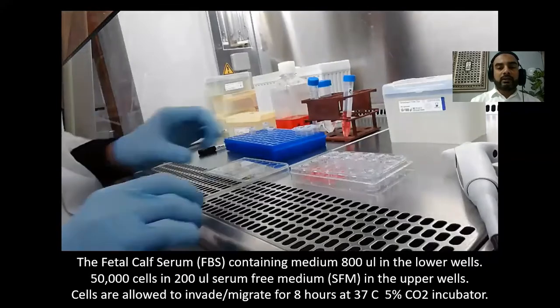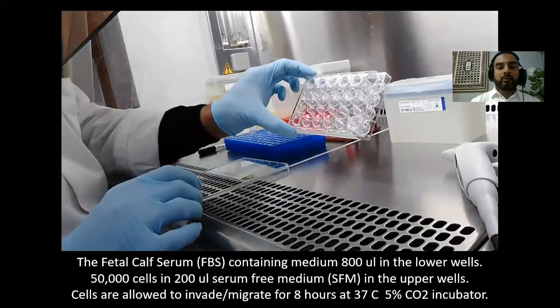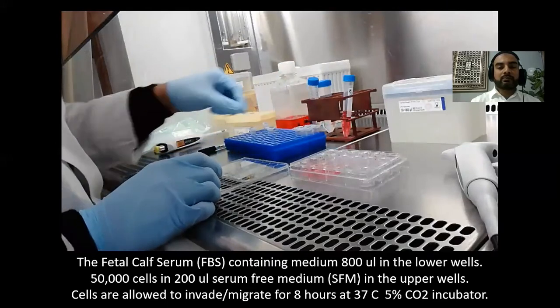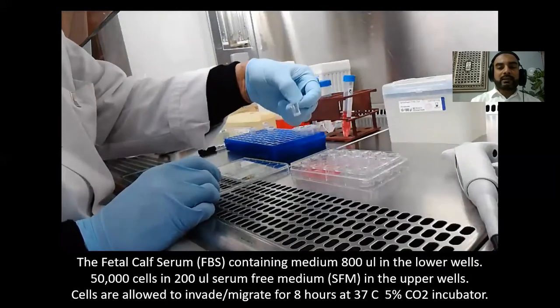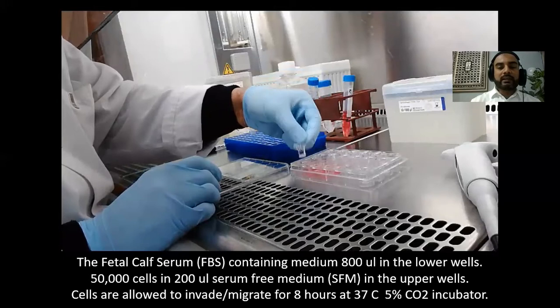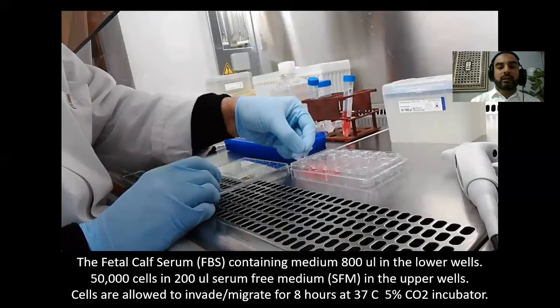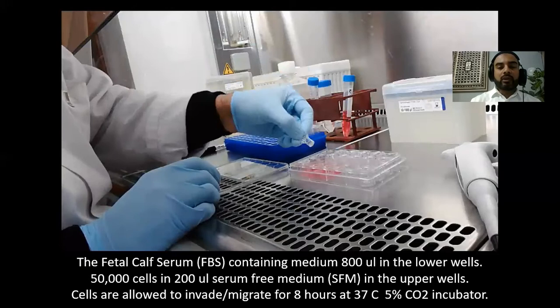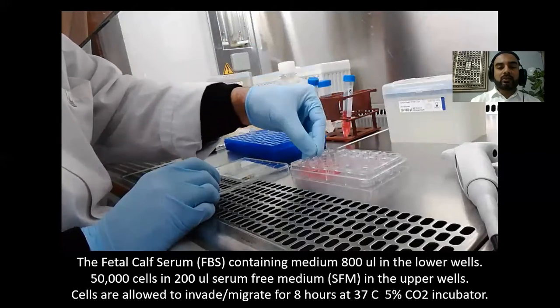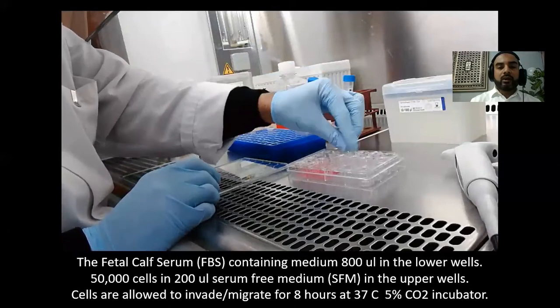You can see that all the lower wells are now loaded with the normal medium. This is the migration insert, and you can see it was coated with collagen IV, so it is ready. We will now put the respective inserts into the wells.